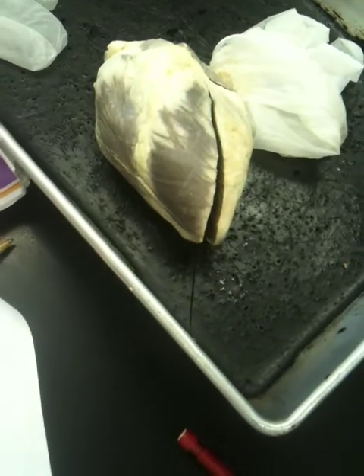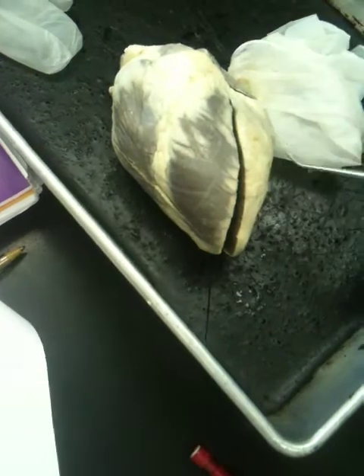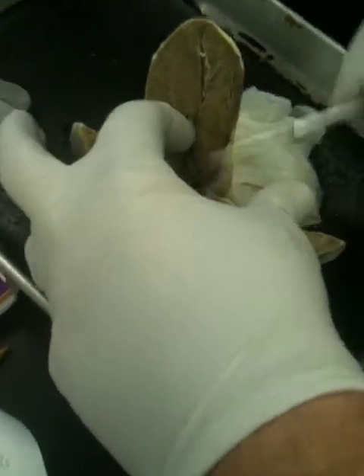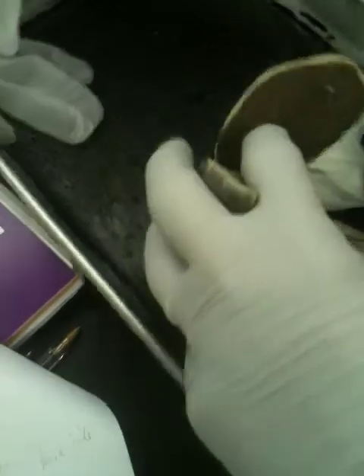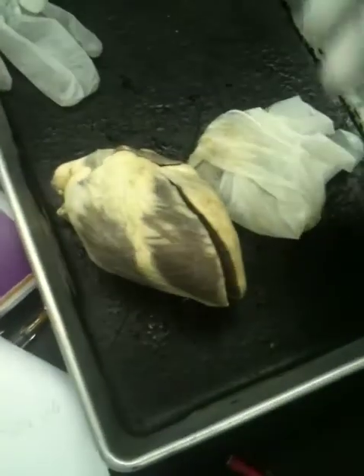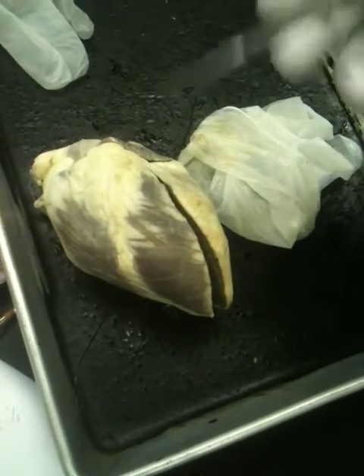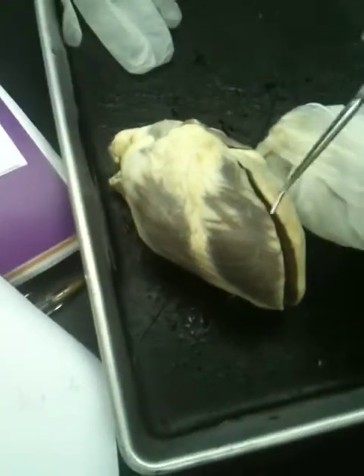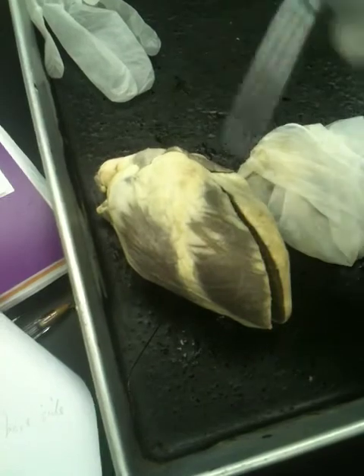So wait, the ventricles would start from like here down? The ventricle, yeah, right. Let me show you where. There's the beginning of the ventricle where the valve is. That's atrium up in there. So this is the ventricle right there, and then atrium is above that. Yep. And what you can see on the outside of the atrium is the auricle, the auricle of the atrium. And on this one, you can see the anterior interventricular sulcus right there.